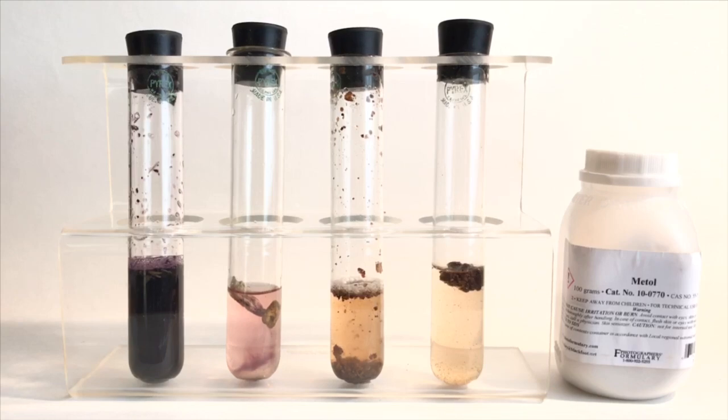Talking about the test would cause the bluing of the stem to be more prominent, whereas the booklet talked about it would color the water. And so I wasn't sure if it was going to bring out the blue bruising in the stem or if it was going to actually color the water. And I think that we have our answer here that it actually colors the water.